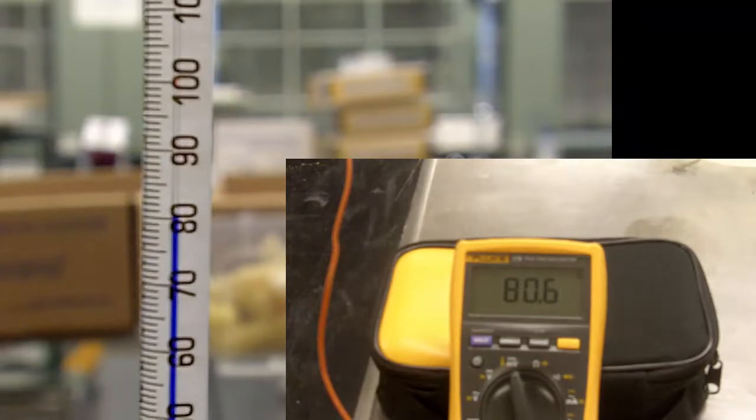If we turn off the meltemp now, we notice that the temperature readings do not continue to go upwards - they start dropping immediately. The digital thermometer shows the tenths place dropping right away once we turn it off, and the traditional thermometer is not going up significantly anymore either - it is probably dropping, though it is harder to see.